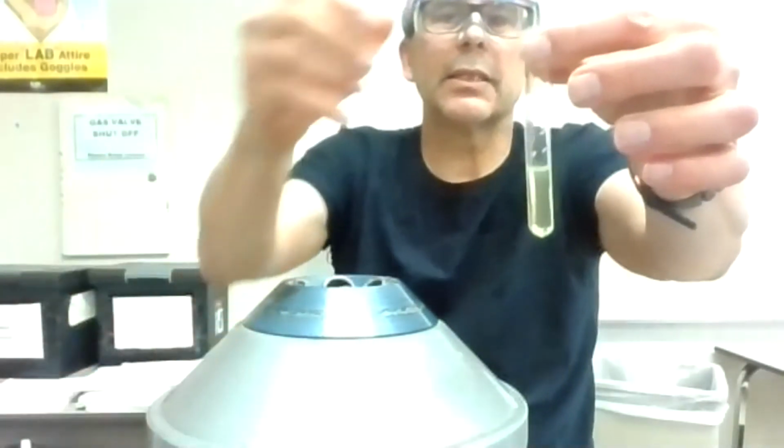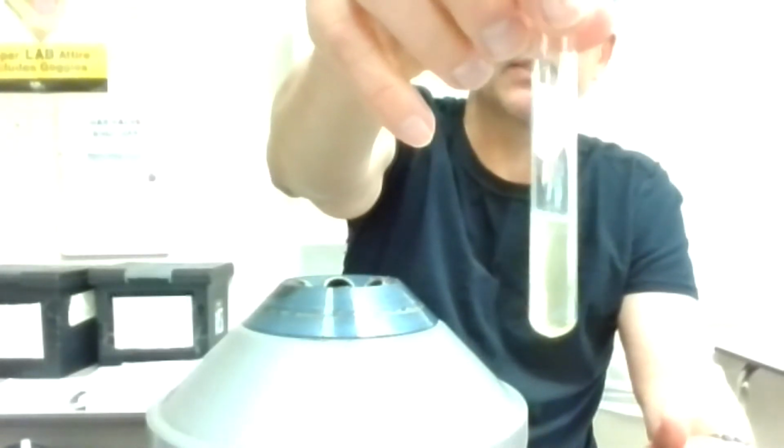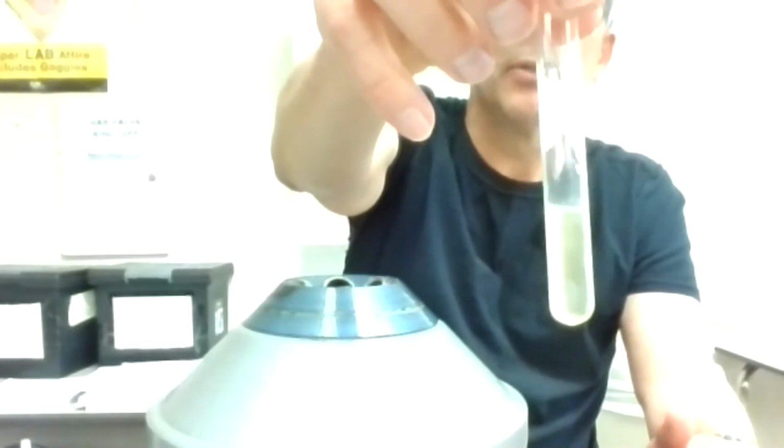This is the least clear-cut of the precipitates, and we're going to see what happens. I'm not seeing much, but it takes about 30 seconds and it tends to frost the glass. Like if you put a mug in the freezer, it frosts the glass. I'm starting to see it frosting up the glass on the outside. So this is by far the weakest test.